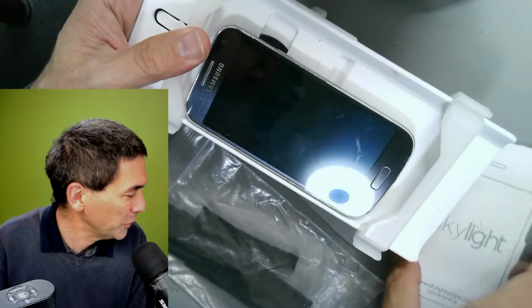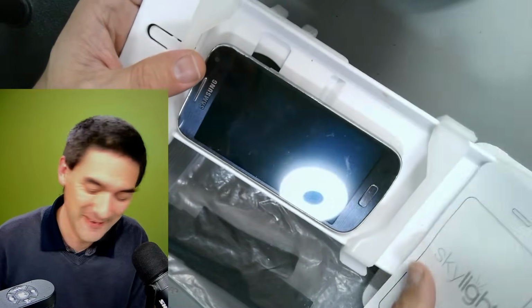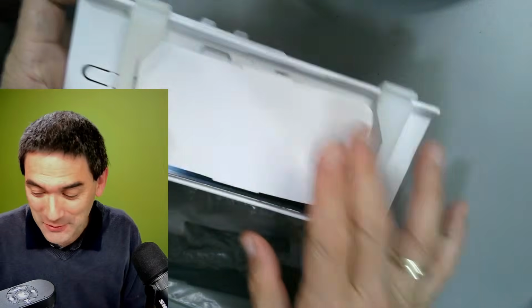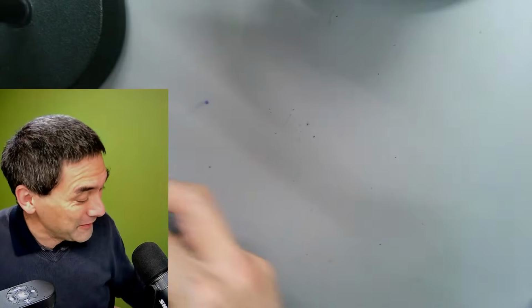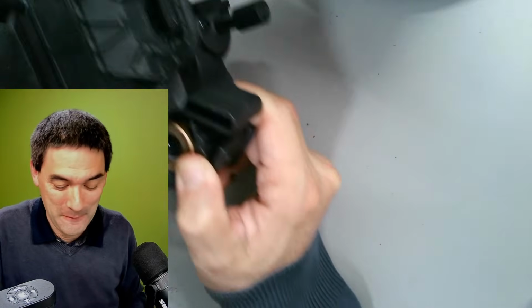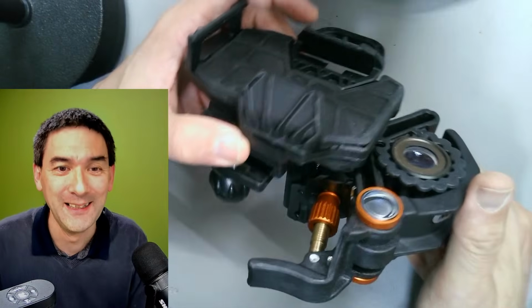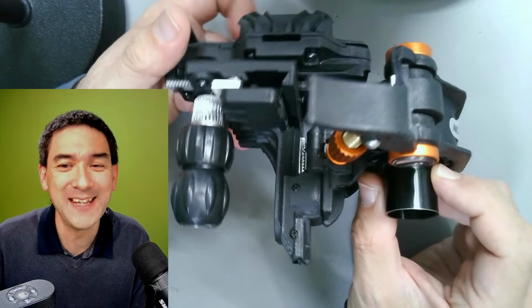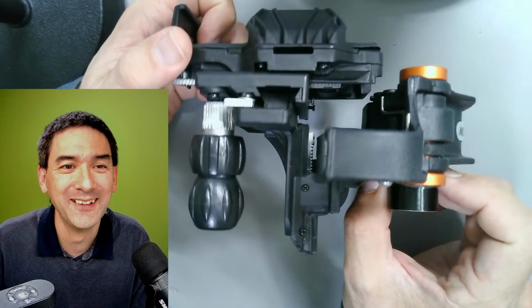Okay, I'm gonna show you another one. And I'm gonna show you my favorite one then at the end. Usually I make review videos, but the next one I did not make a review video yet. This is the coolest one. This is scary looking. This is what I call over-engineered. Look at this guy here. Here's the eyepiece. This thing is heavy.